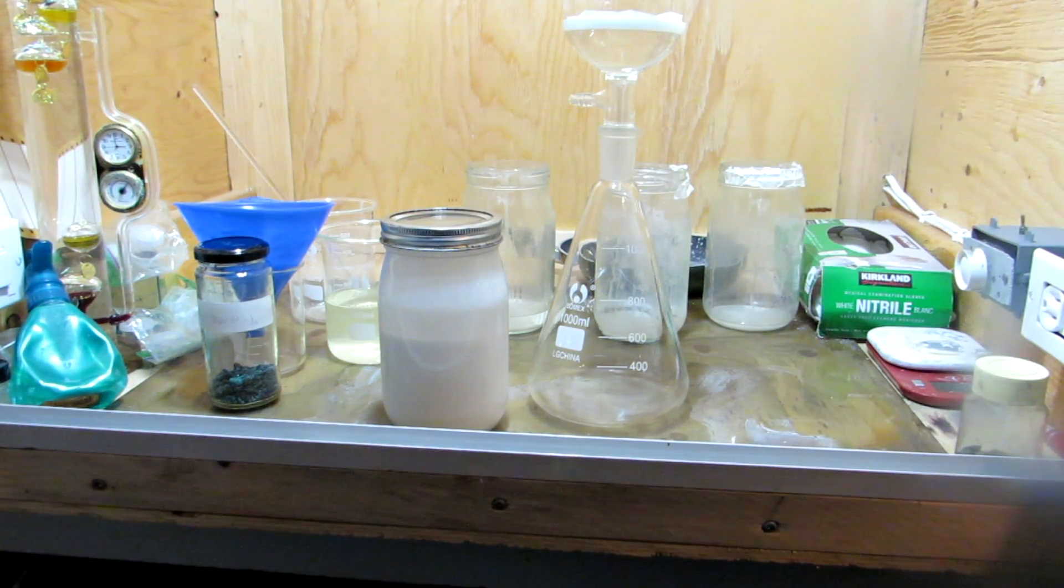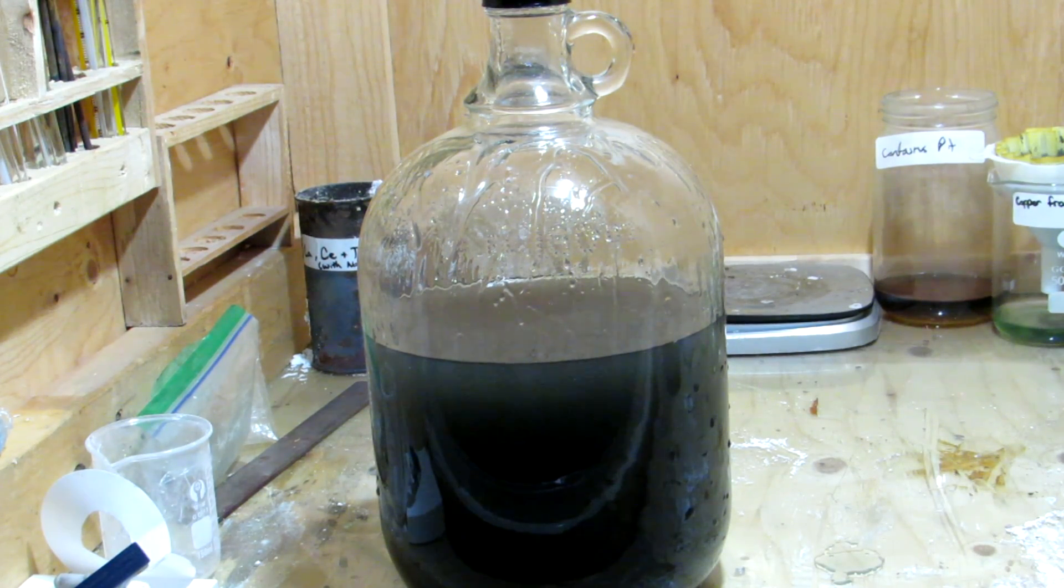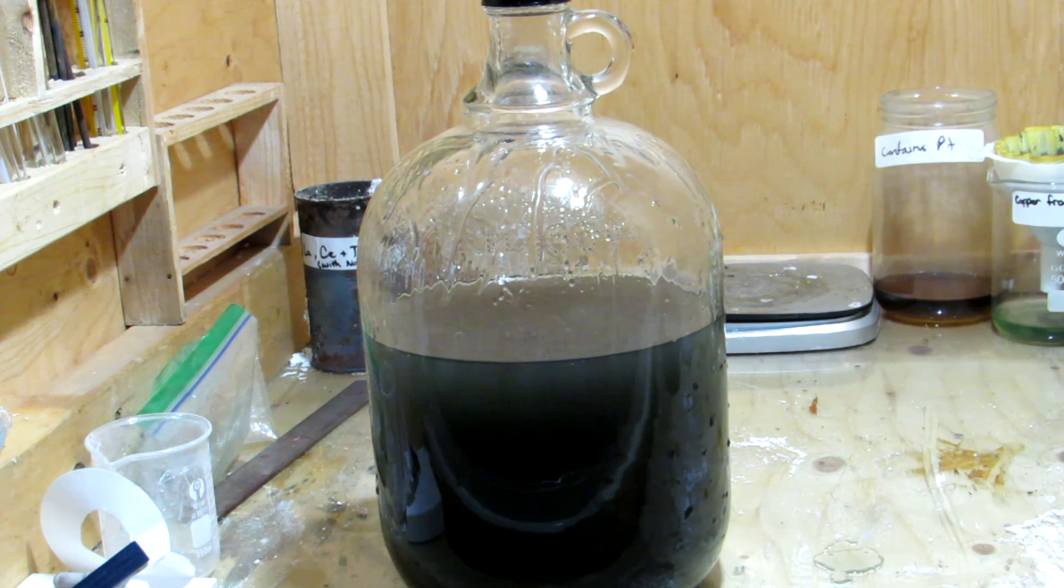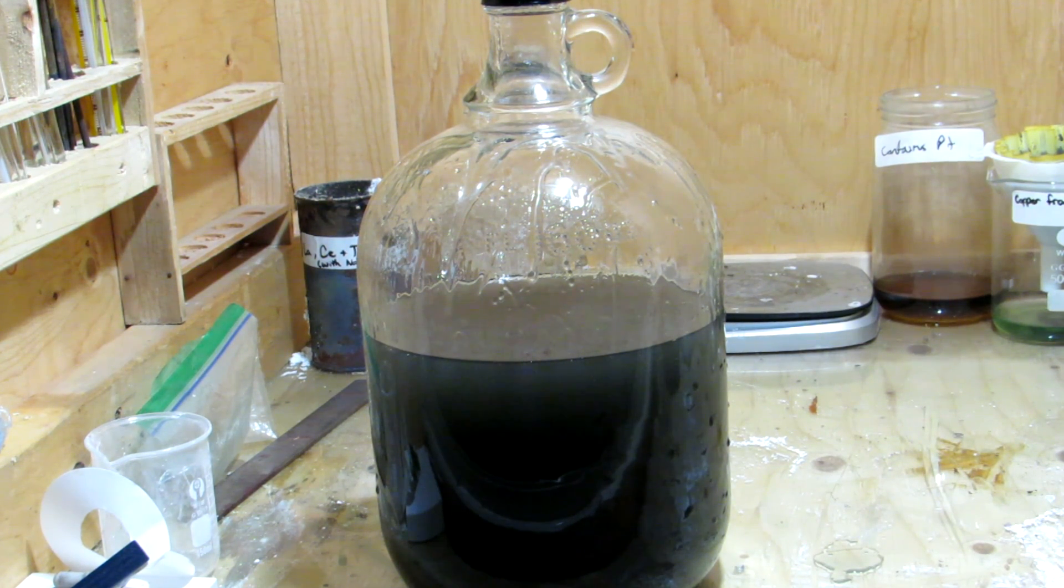Anyhow, that is essentially how to prepare sodium silicate, also known as water glass, from silicon dioxide. I hope you guys enjoyed and I'll see you in a future video. Okay, bye.